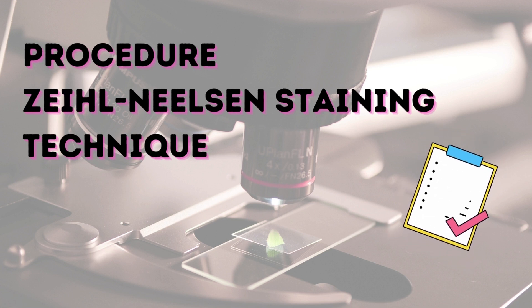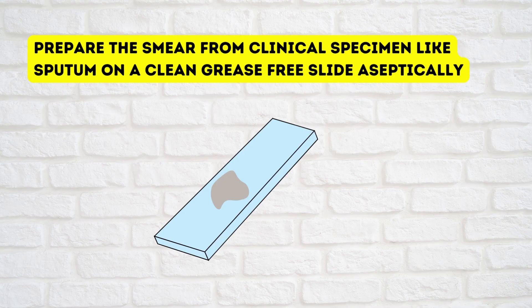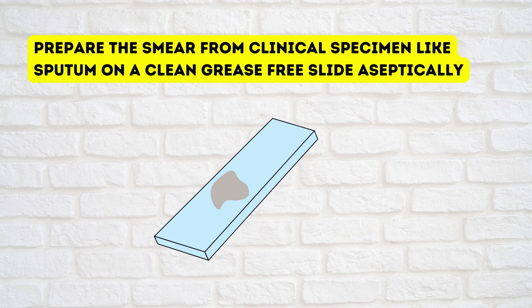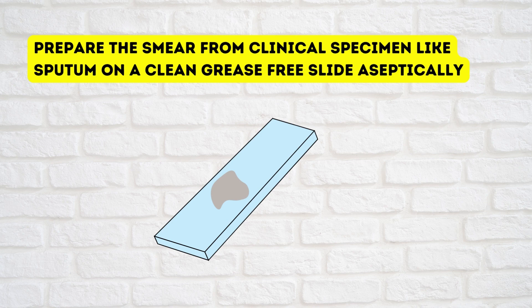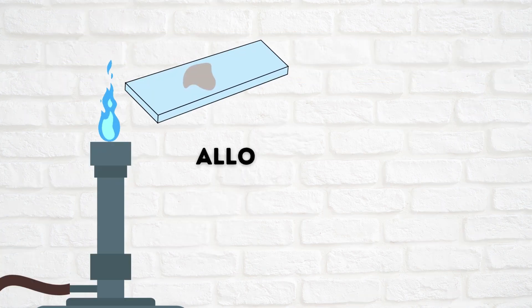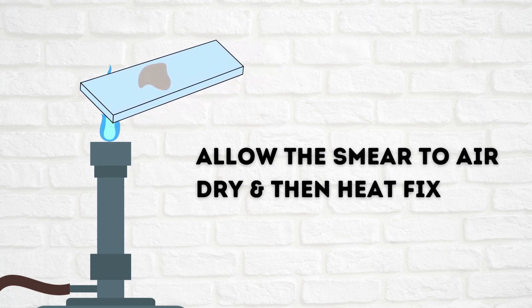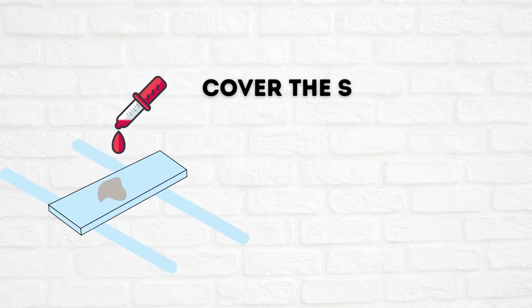Let us see the different steps involved in the staining technique. First, you need to prepare the smear from a clinical specimen — particularly for Mycobacterium tuberculosis causing pulmonary tuberculosis, we prefer sputum. Prepare the smear from the thick purulent portion of the sputum on a clean, grease-free, scratch-free slide aseptically. Allow the smear to air dry, then heat-fix it by passing through a flame.